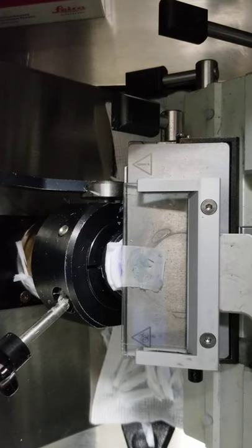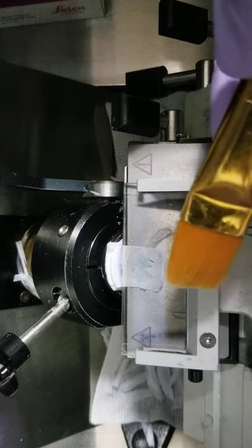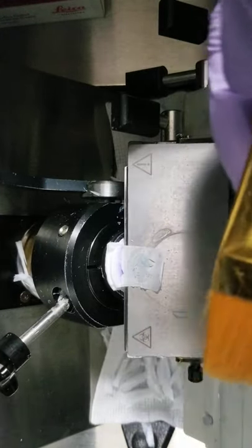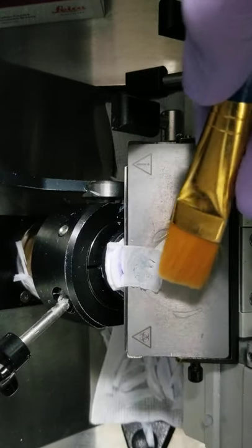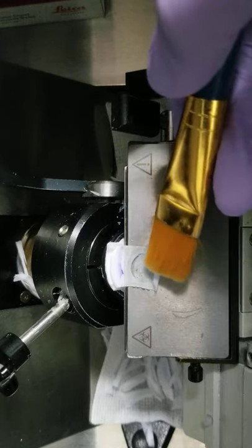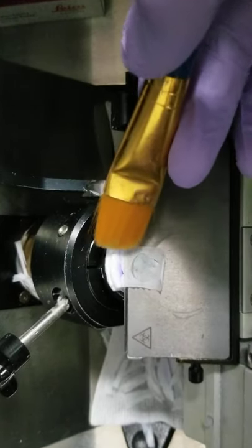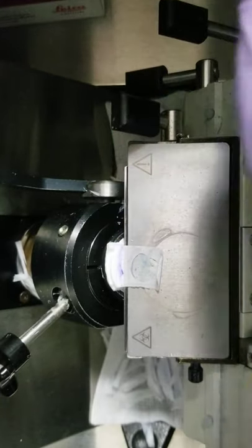And then this is one part that some people kind of goof up on: you don't want to pull the roll plate up too fast, because that will actually lift it. You just use your brushes to kind of tease out. This isn't my actual brush, so forgive. Tease that out and press it down. And like I said, this isn't tissue, so it's separating at the top where it would stick.